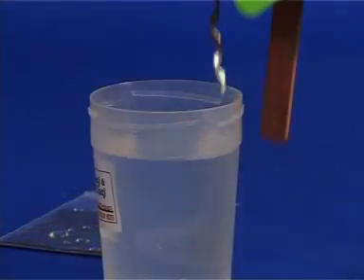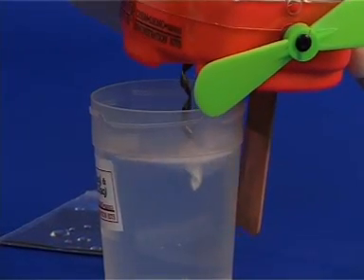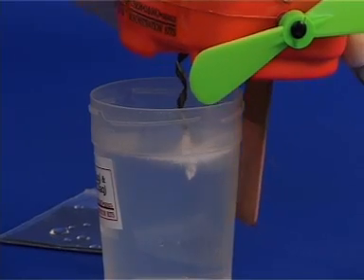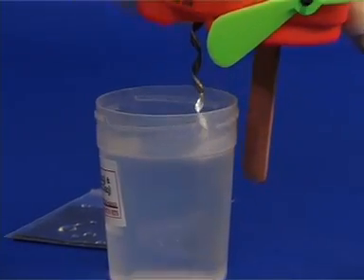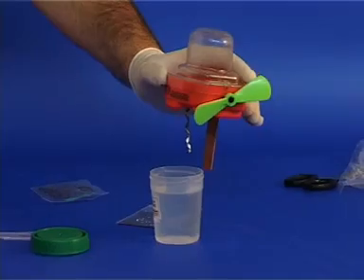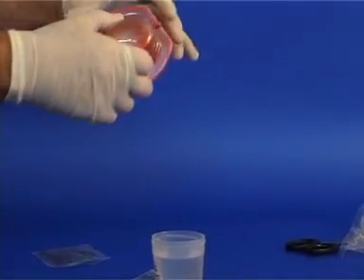Now, dip only the magnesium coil into the solution and observe a strong reaction, followed by the appearance of bubbles. However, once again, the motor does not turn.